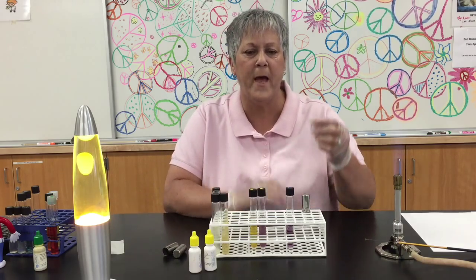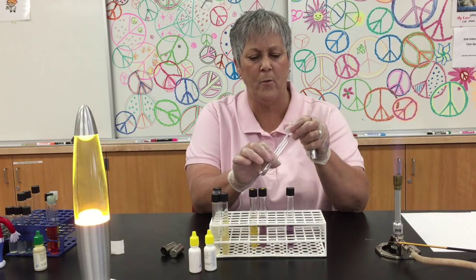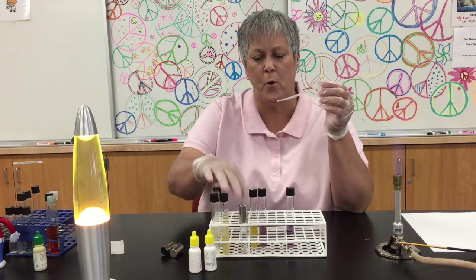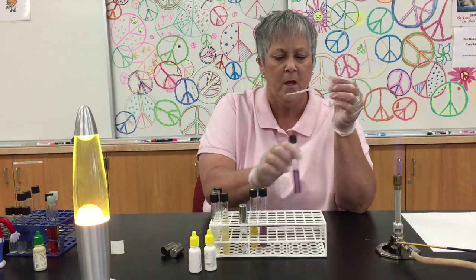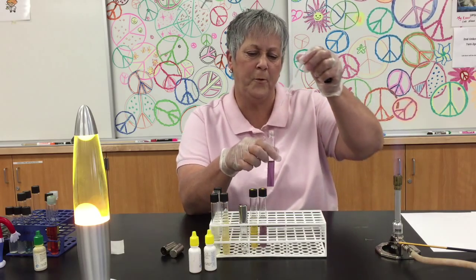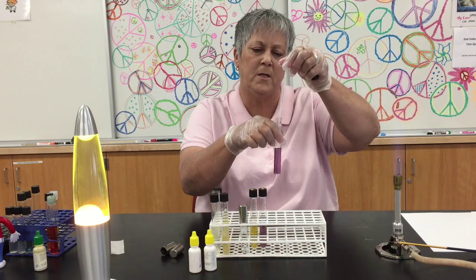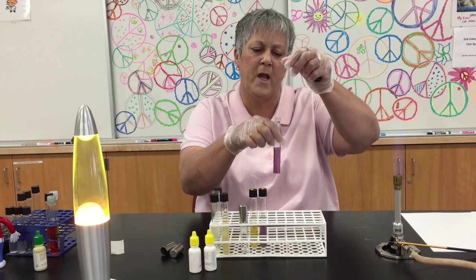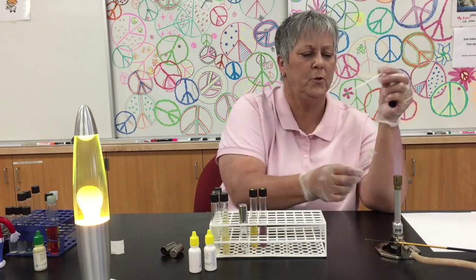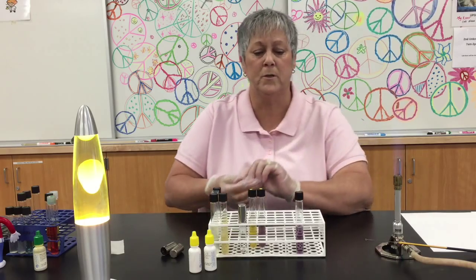I'm going to go ahead and use a pipette. I'll remove the cap and get a little bit of the mineral oil out with my pipette. I'm not worried about keeping this sterile at this point, because if there's any oil left over it's going to be disposed of. This is the tube I inoculated a minute ago. I'm going to flame the lip of the tube and add my sterile mineral oil, taking care not to touch the pipette to the tube so that I can use it for my other tubes. Flame the lip of the tube again, replace the cap, and this tube is ready for incubation.